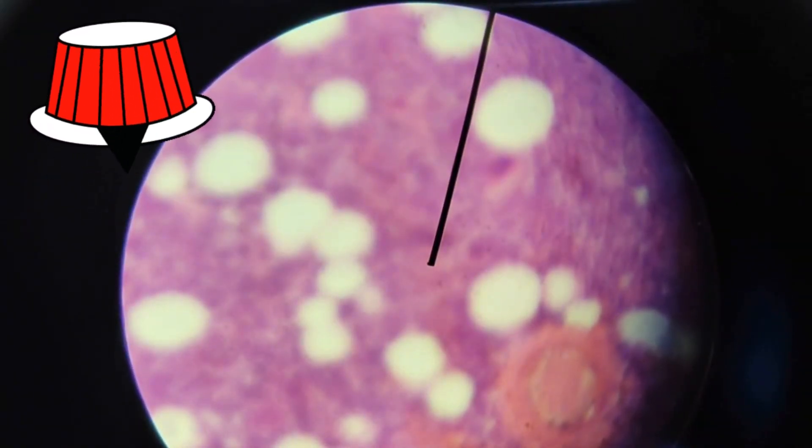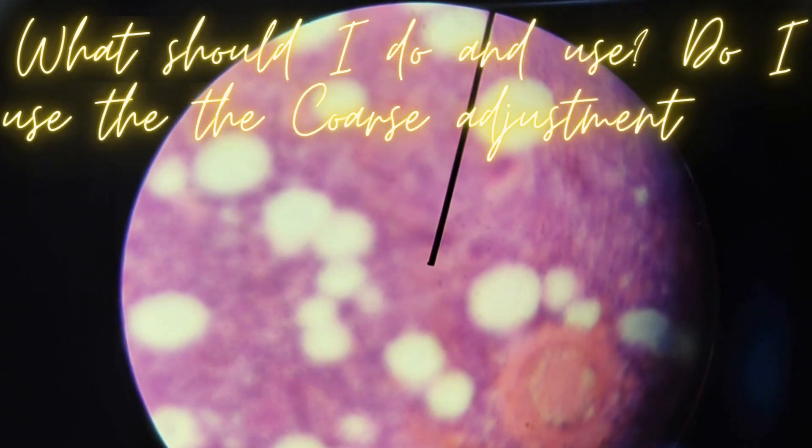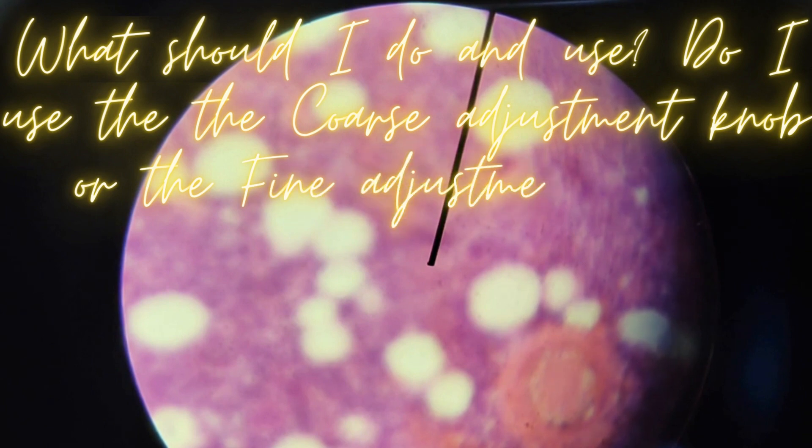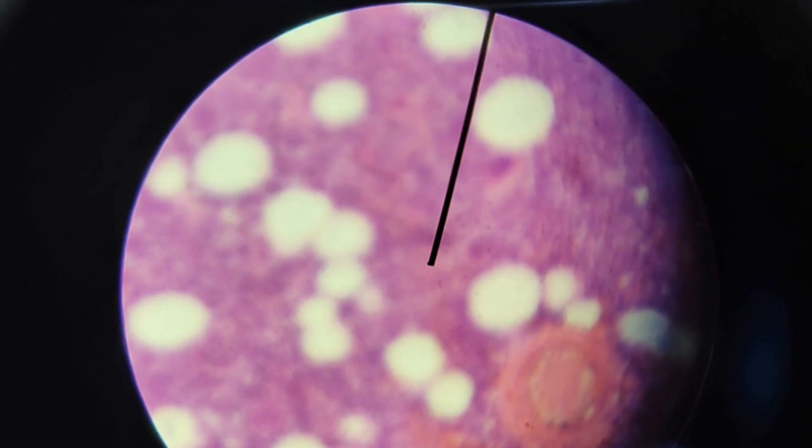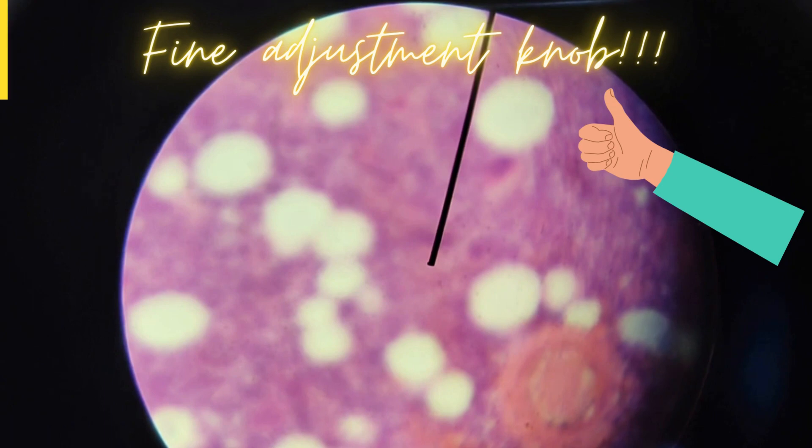it's still kind of unclear. So what should I do? Should I use the coarse adjustment knob or the fine adjustment knob? If you said fine adjustment knob, you are correct.